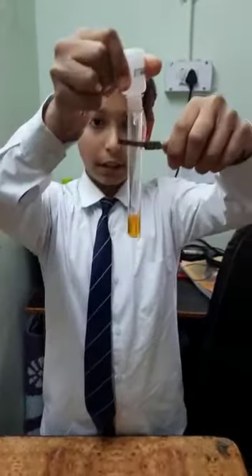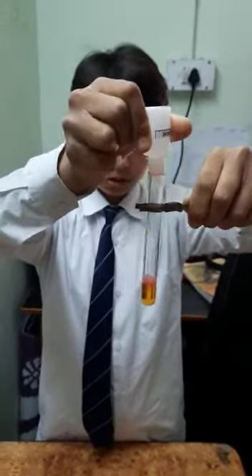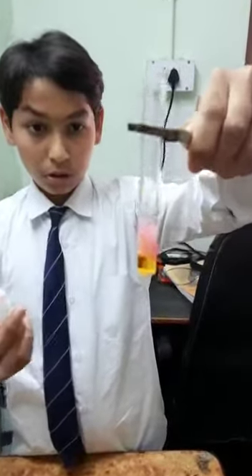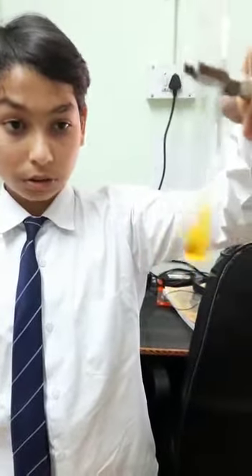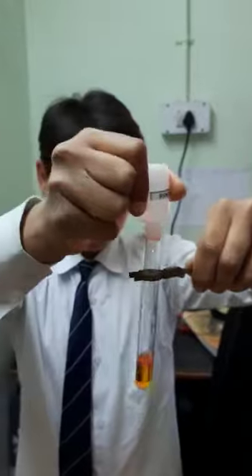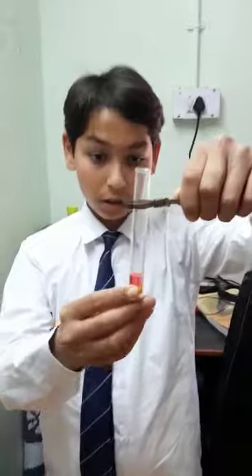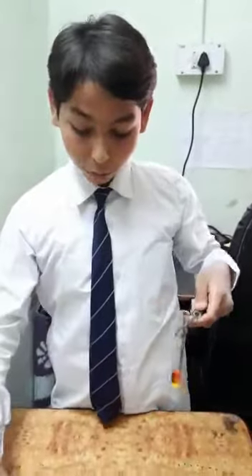We can see that it is releasing CO2 gas. You can see it — so it becomes slightly orange and red color. We can prove that we neutralized a base by an acid.